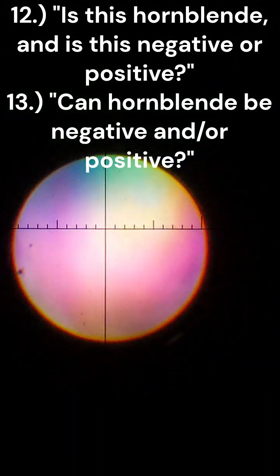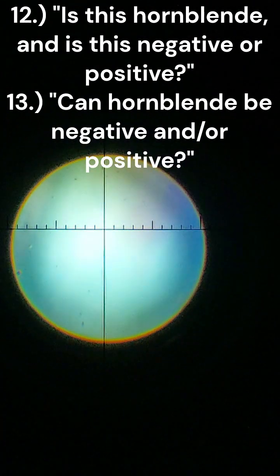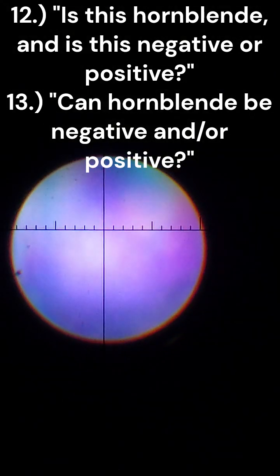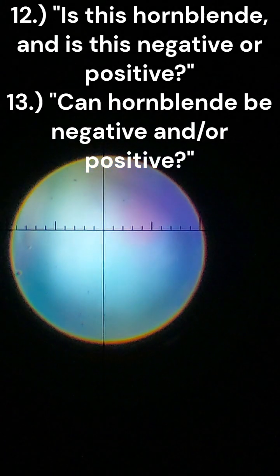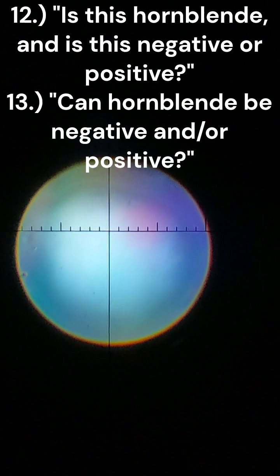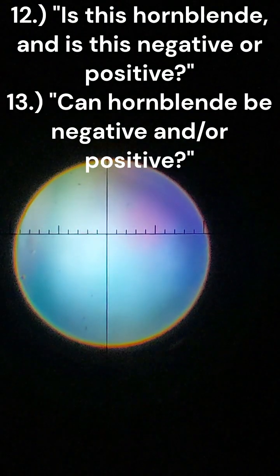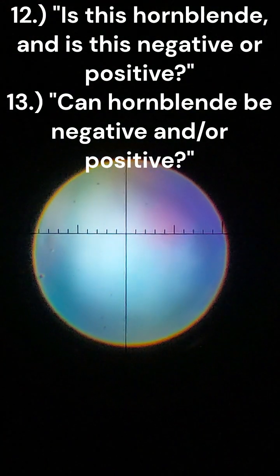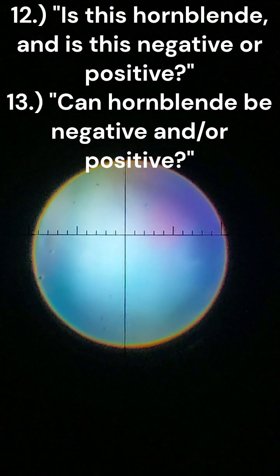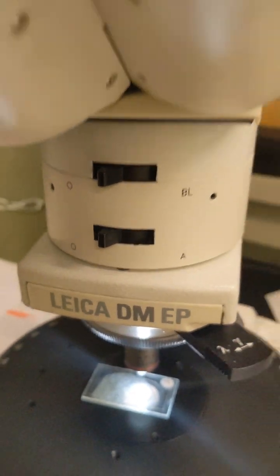Whereas we have right here where the isogyres are top right, bottom left, and northeast, southwest rather. Blue's in the middle, and we do have an amount of orange that is leaving and going upright. So I believe this would be biaxial negative. Unfortunately, I believe hornblende is positive/negative, so I'm not really sure how I should be able to identify that. Could you please confirm if this is or is not hornblende, and if it is, how this might be characteristic of it?